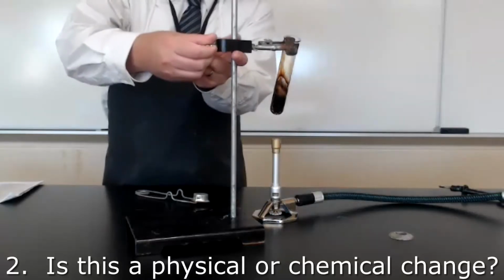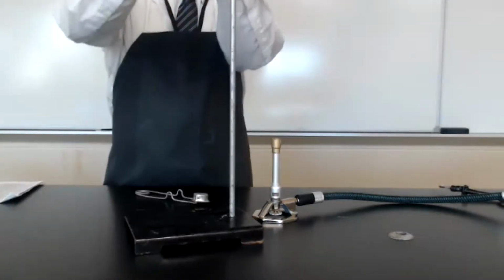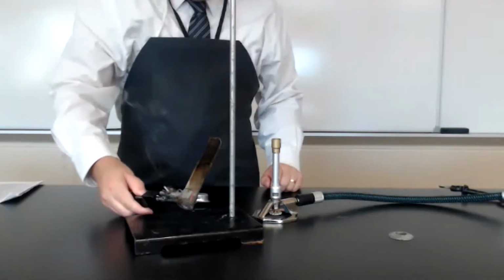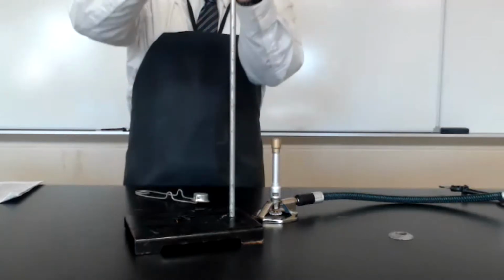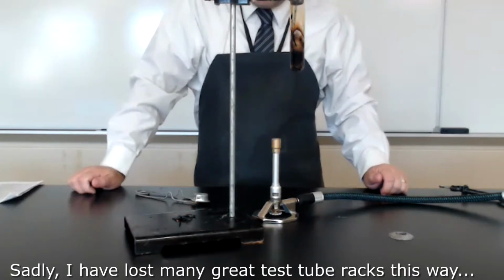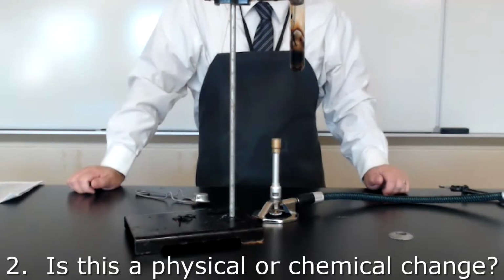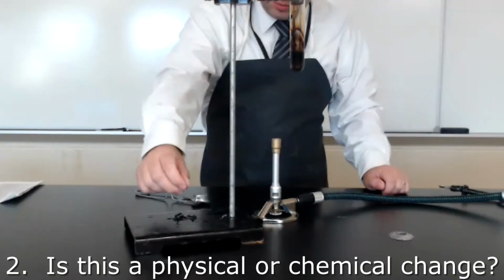I'm going to be very careful here. I'm going to loosen my utility clamp. You can see the charred wood. I'm also going to pour out some of this sample onto here so you can see what it looks like. Be sure to allow the test tube to cool completely, and do not stick it in a test tube rack when the test tube is extremely hot. It will burn and damage the rack. Decide, did a physical change or a chemical change occur? This is our final product.